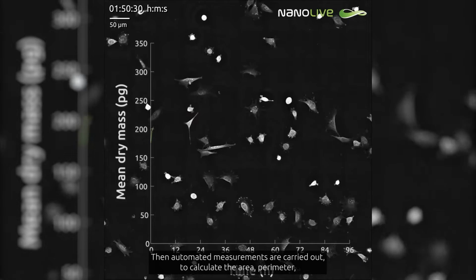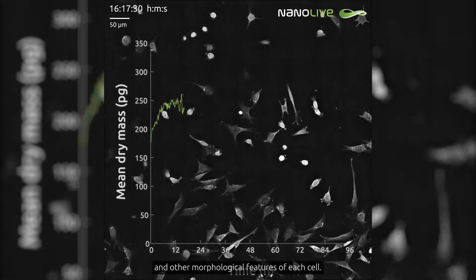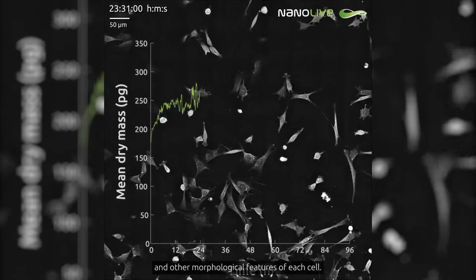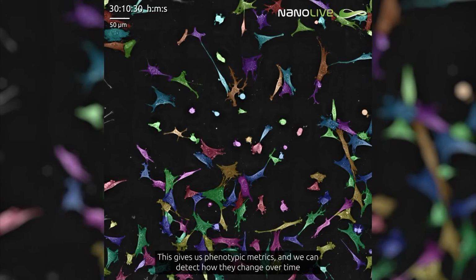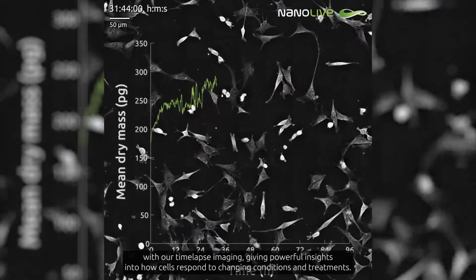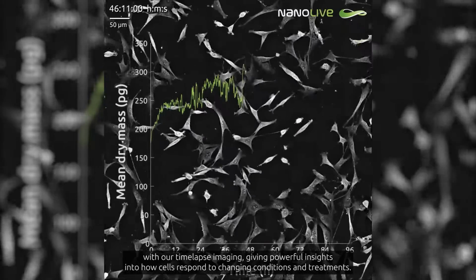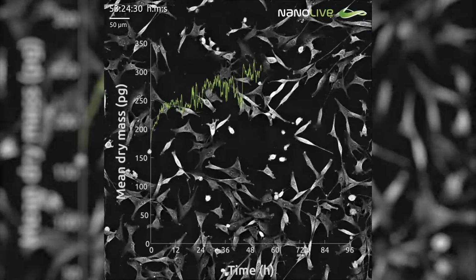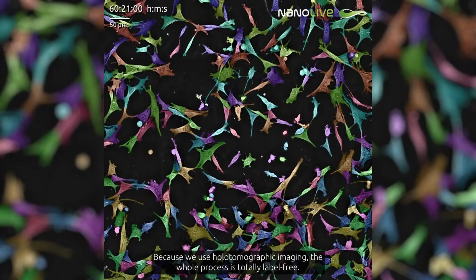Then automated measurements are carried out to calculate the area, perimeter, and other morphological features of each cell. This gives us phenotypic metrics, and we can detect how they change over time with our time-lapse imaging, giving powerful insights into how cells respond to changing conditions and treatments. Because we use holotomographic imaging, the whole process is totally label-free.